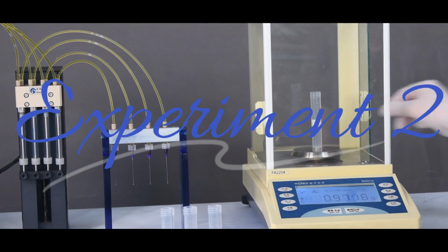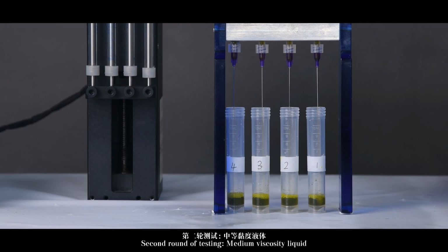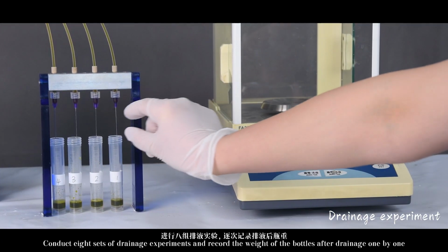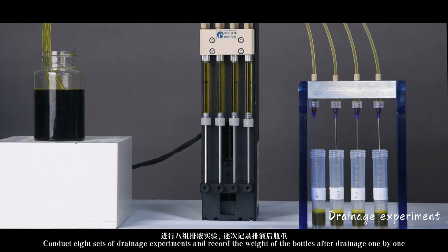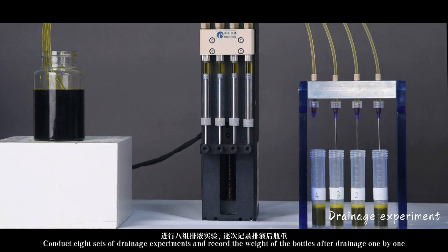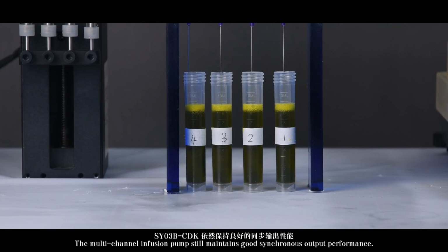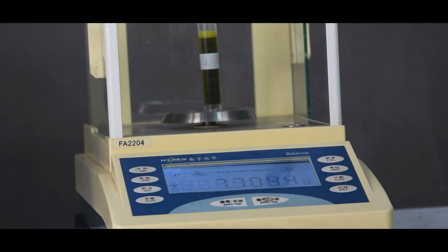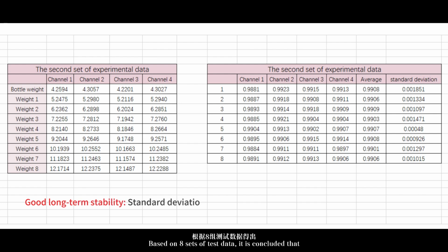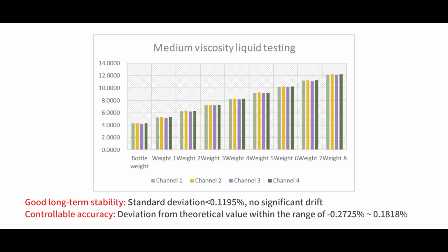Experiment 2. Second round of testing, medium viscosity liquid. Conduct 8 sets of drainage experiments and record the weight of the bottles after drainage one by one. The multi-channel infusion pump still maintains good synchronous output performance. Based on 8 sets of test data, it is concluded that the flow output of the 4 channels is synchronized, and the single lateral deviation rate does not exceed 0.27%.